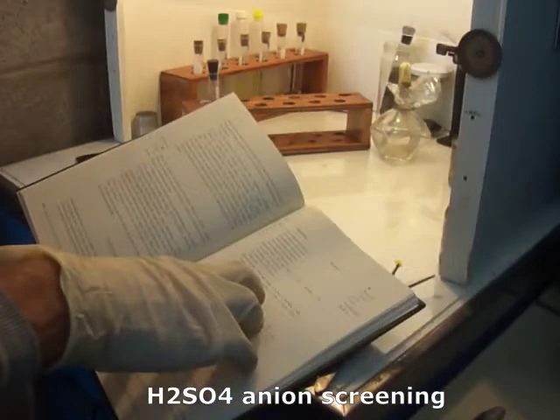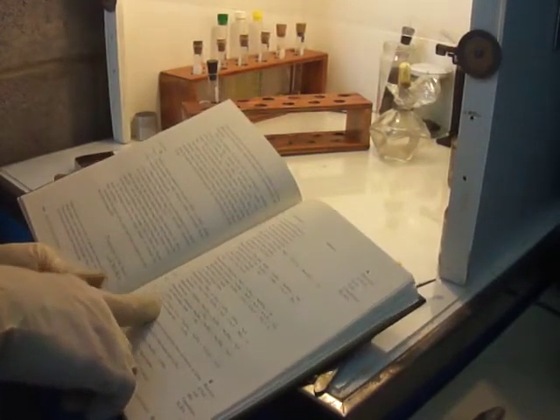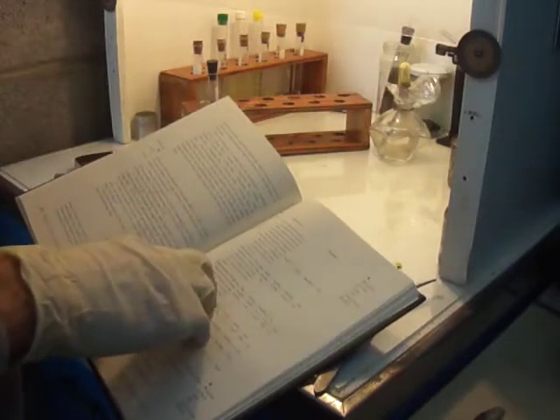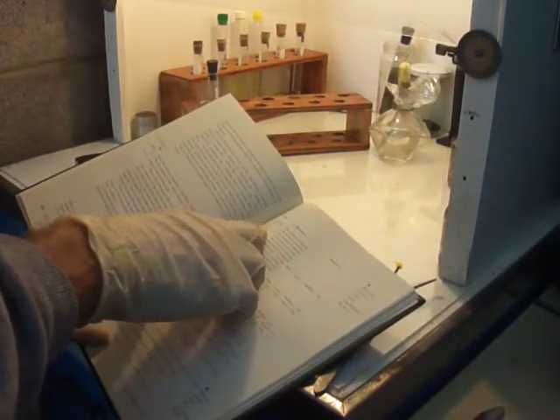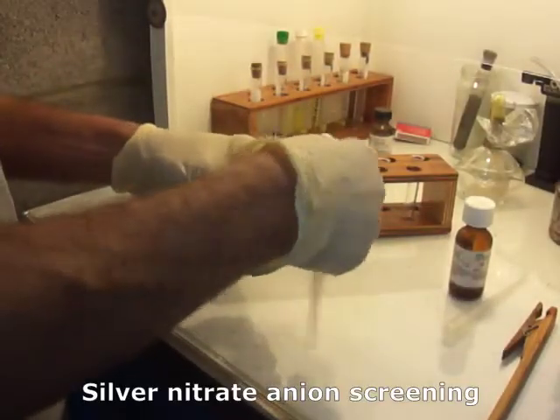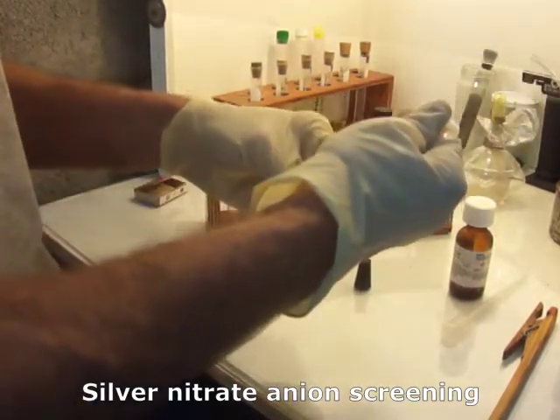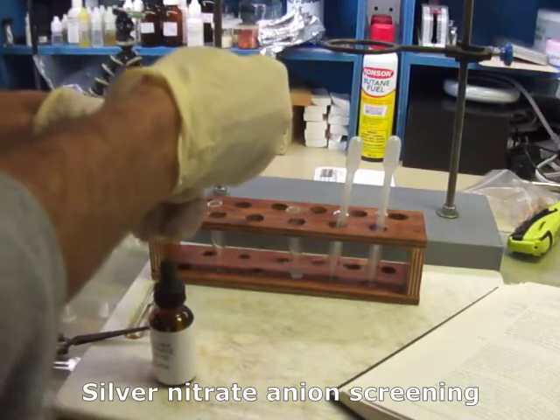The anions that don't effervesce include chromate, but that changes color, so that's not it. The other ones that have no reaction are acetate, sulfate, phosphate, borate, arsenate, and nitrate. Fortunately, I saved the water-soluble sample that I made for the cation testing. Let's do the silver nitrate test too.